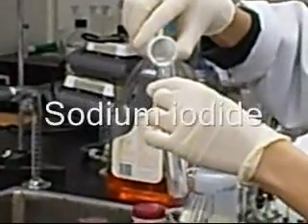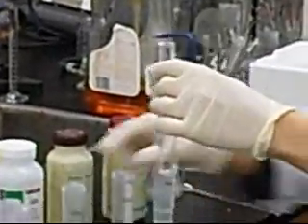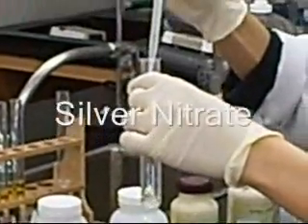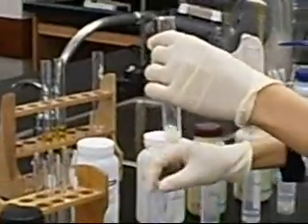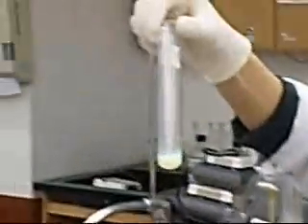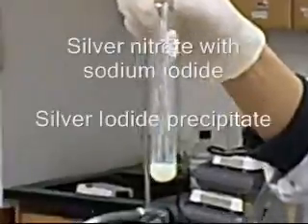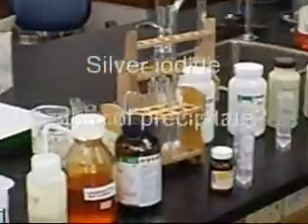First, sodium iodide solution — put it in a test tube and add a few drops of silver nitrate. A precipitate forms. Observe the color of the precipitate. This precipitate is silver iodide, that's the product.